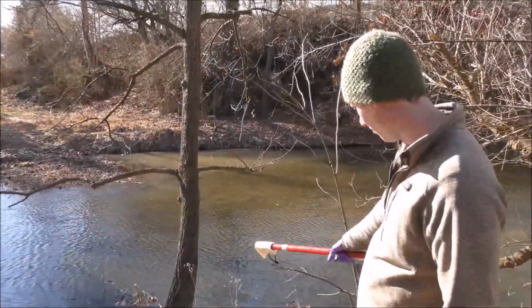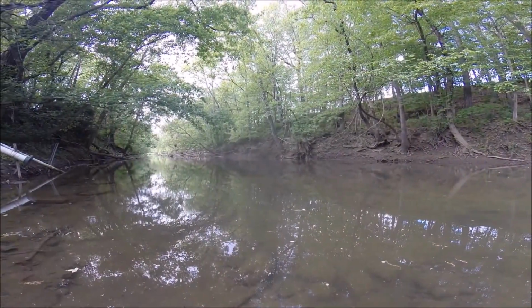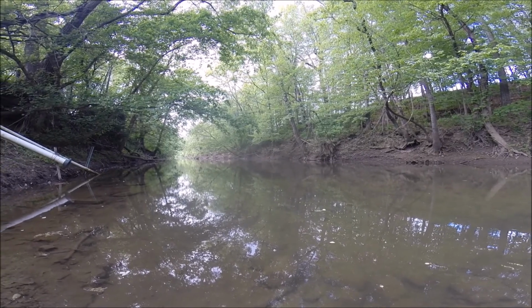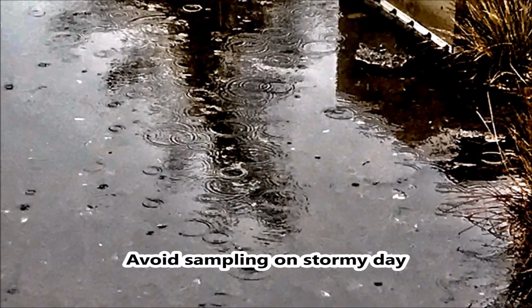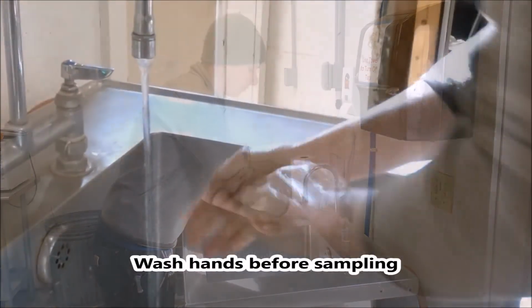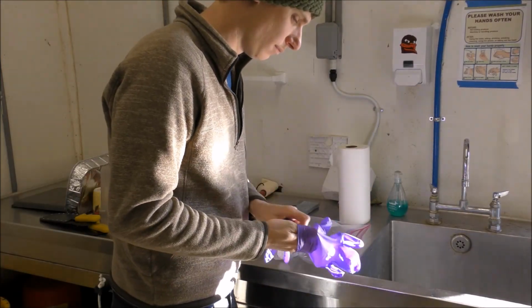Prior to the collection day, identify a good sampling area that is consistently accessible and close to the water intake pump. While you have created a schedule of sampling dates, avoid collecting water from surface water sources when you typically would not use the water for produce production activities, such as on a stormy day. Just before sampling, wash your hands with soap and water for 20 seconds, and then dry hands with paper towels and put on nitrile gloves. This will help prevent cross-contamination of the sample.